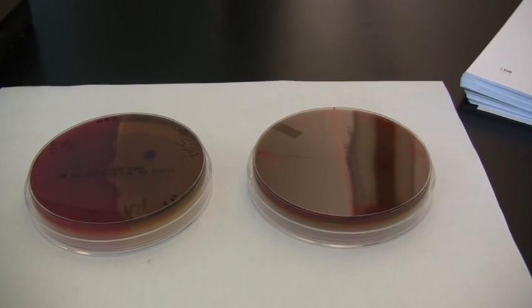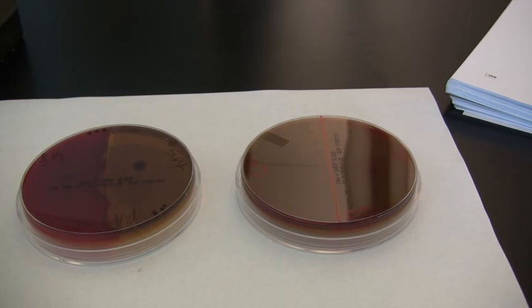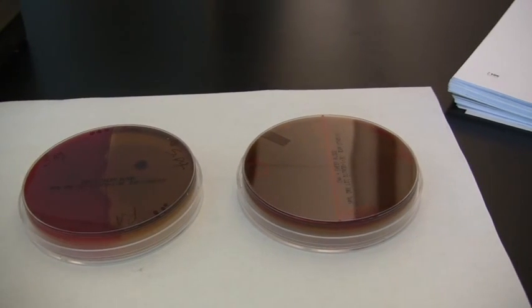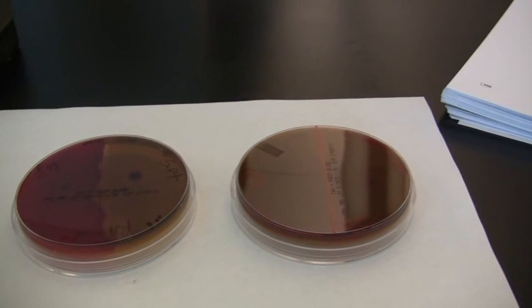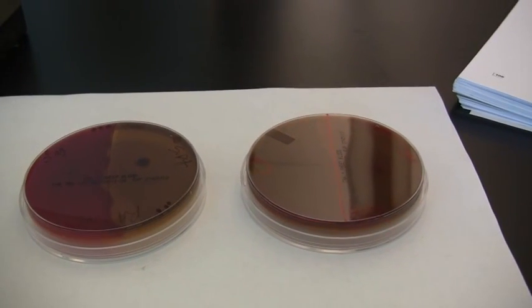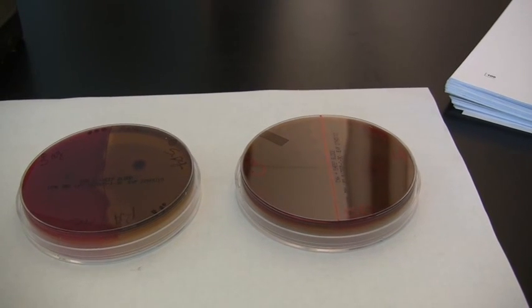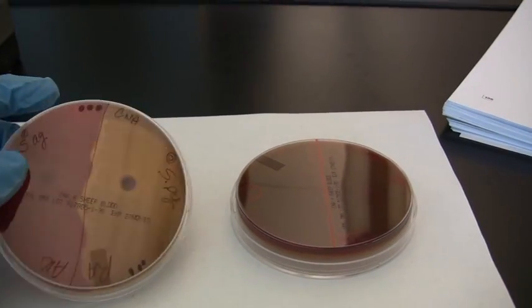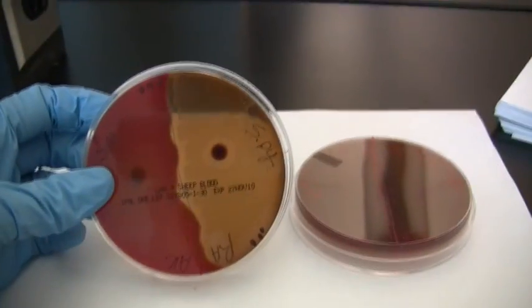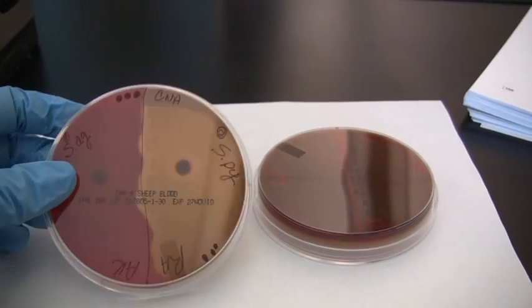We also have blood included as a differential material, and we're looking for varying degrees of hemolysis reaction. So I'll talk about those as we go through the results. Most of this should be reviewed from CNA blood that we covered earlier in the semester when we first introduced selective and differential media. If the organism is able to completely hemolyze the blood, meaning that it completely breaks it down, you'll have a complete clearing.